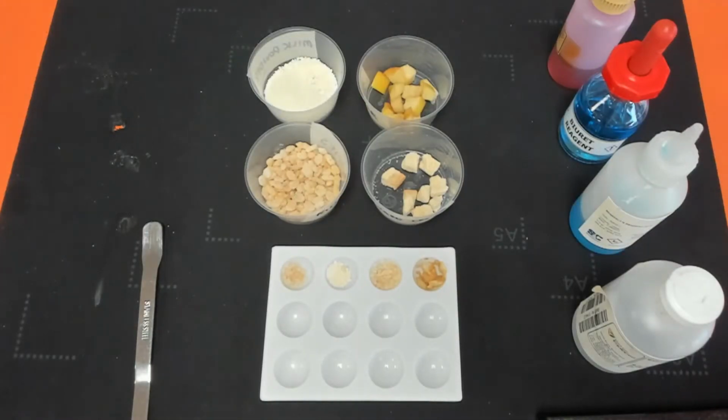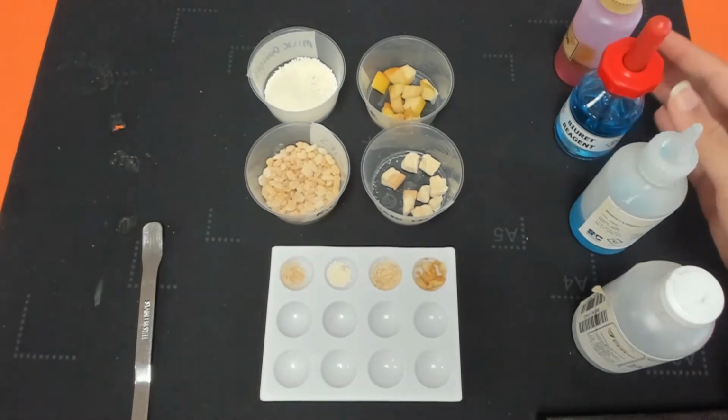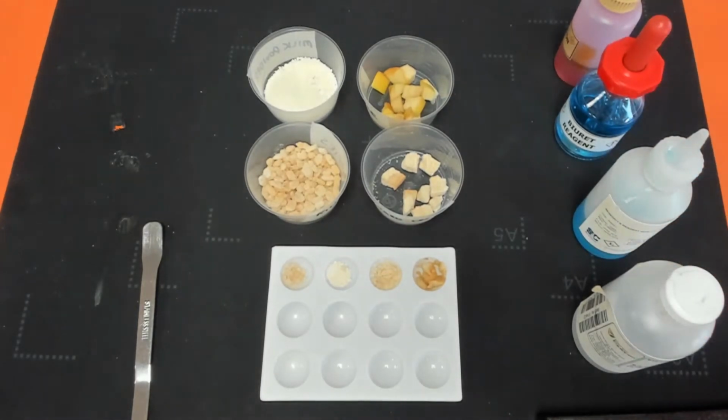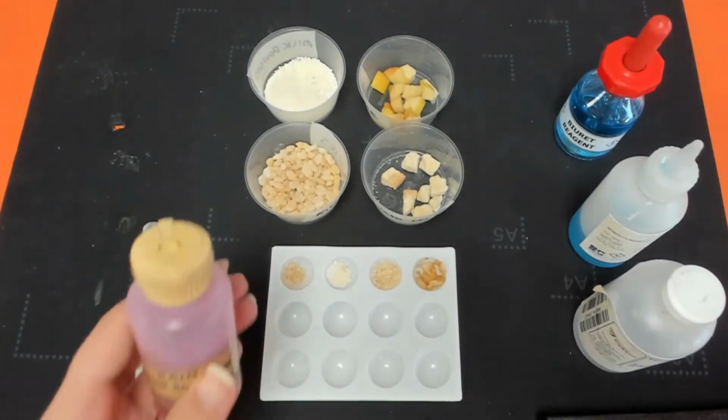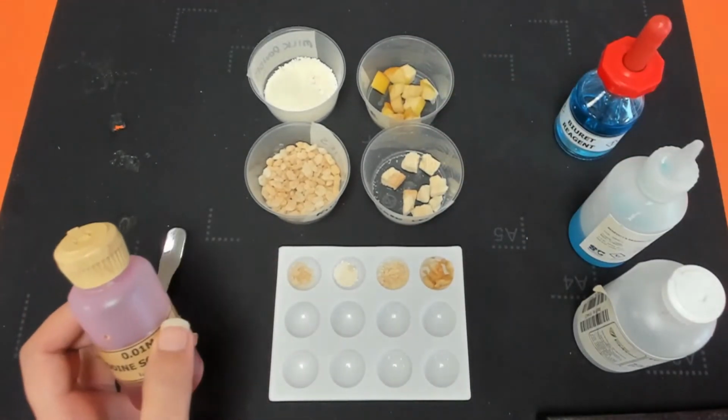In this video, we'll be looking at how to carry out the food test required practical. So we're going to be testing for sugars, lipids, proteins, and also starch. And the way that we do that is by using the different reagents that you can see all along the side here. We're going to start off with iodine. So iodine is used to test for starch.